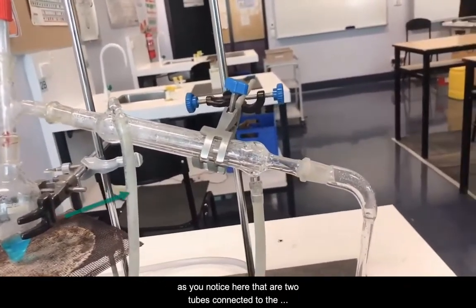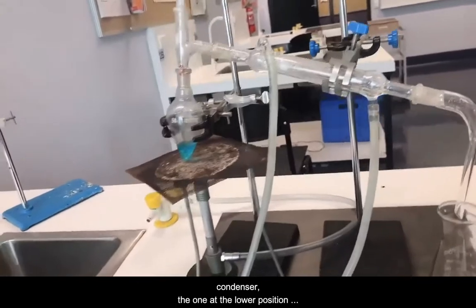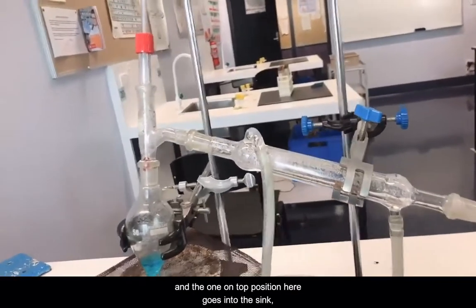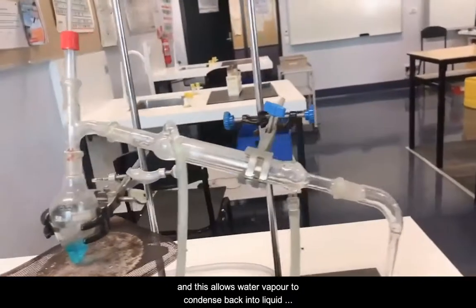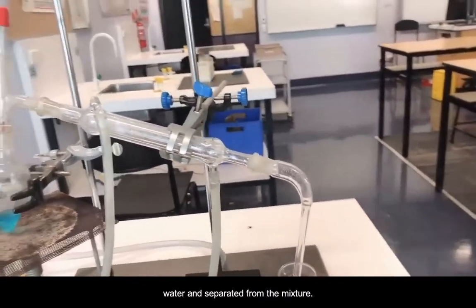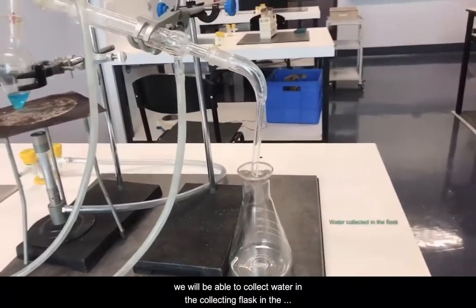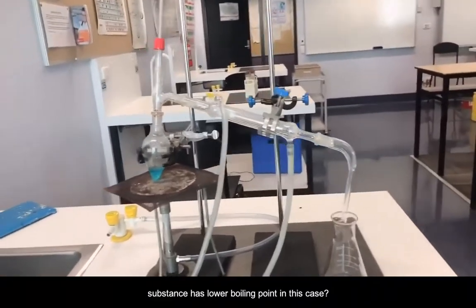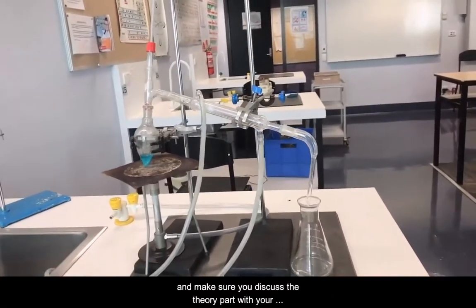As you notice here, there are two tubes connected to the condenser. The one at the lower position here is connected to the tap water supply, and the one at the top position here goes into the sink, and this allows water vapor to condense back into liquid water and separate from the mixture, and we'll be able to collect water in the collecting flask in the end. So think about which substance has the lower boiling point in this case, and make sure you discuss the theory part with your teacher in class.